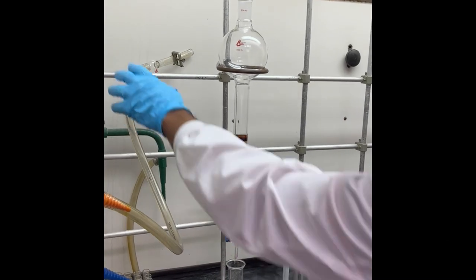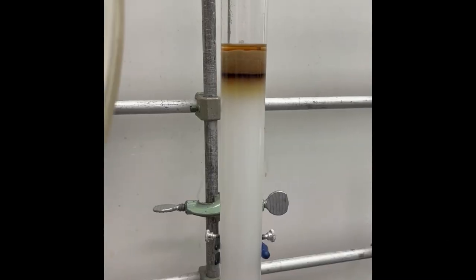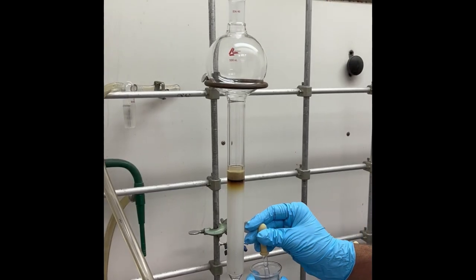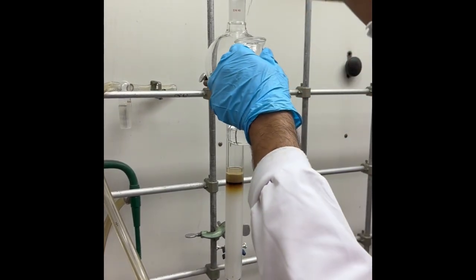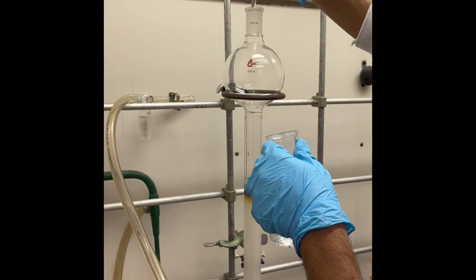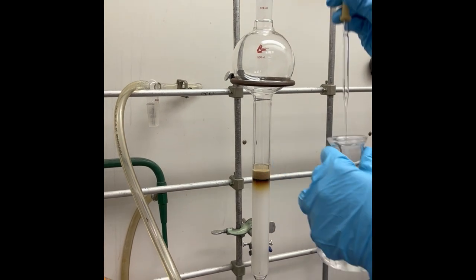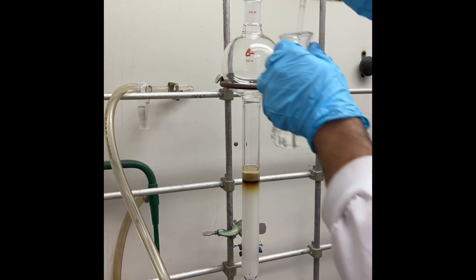Using airflow, the mixture should enter the silica layer. More solvent is added to carefully clean the inner walls of the column. This washing process is repeated to ensure all the mixture has entered the silica gel bed as a concentrated band. No product should remain on the column wall.